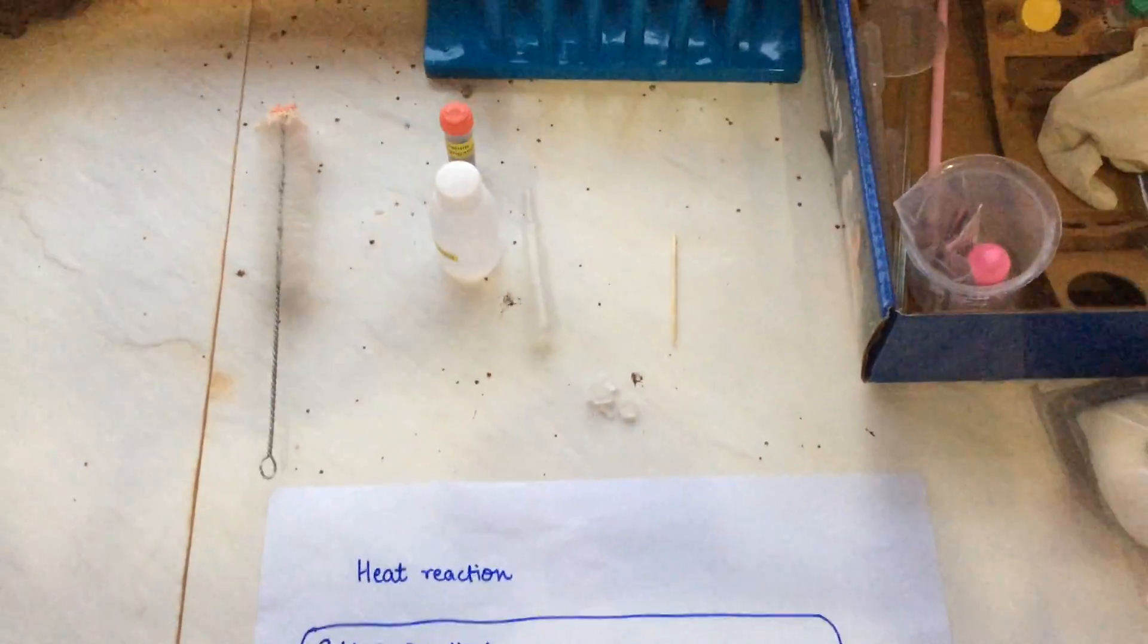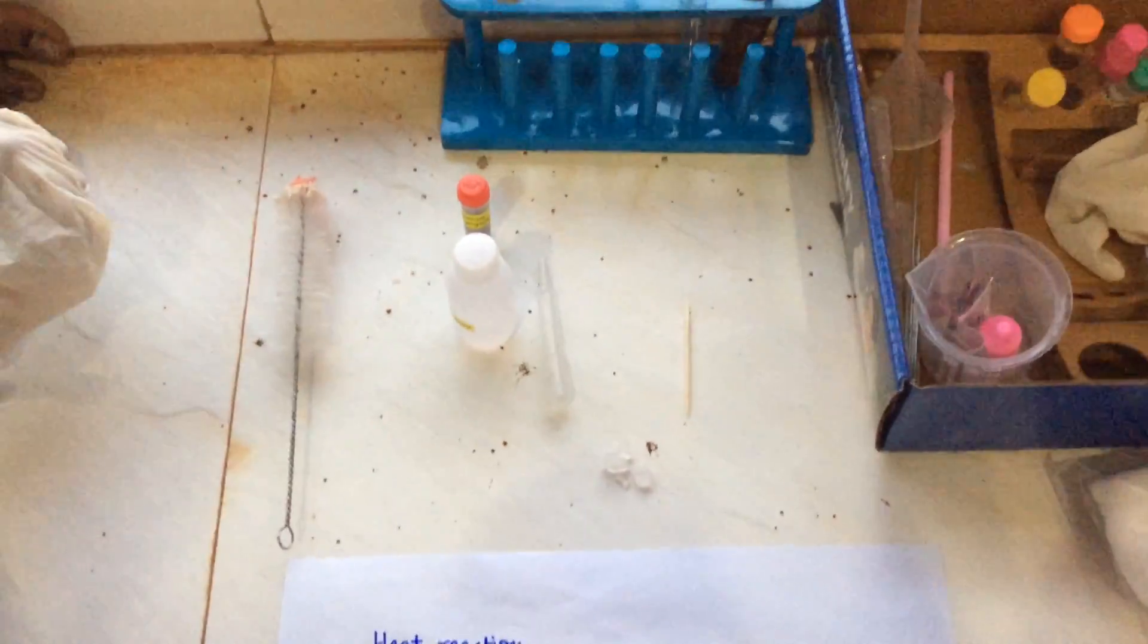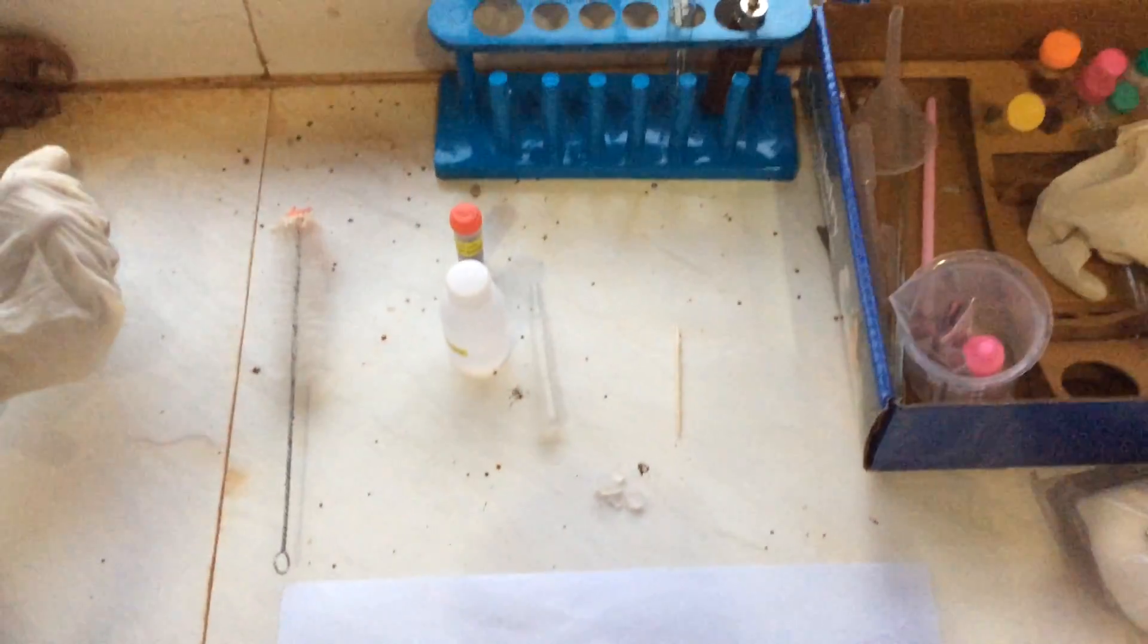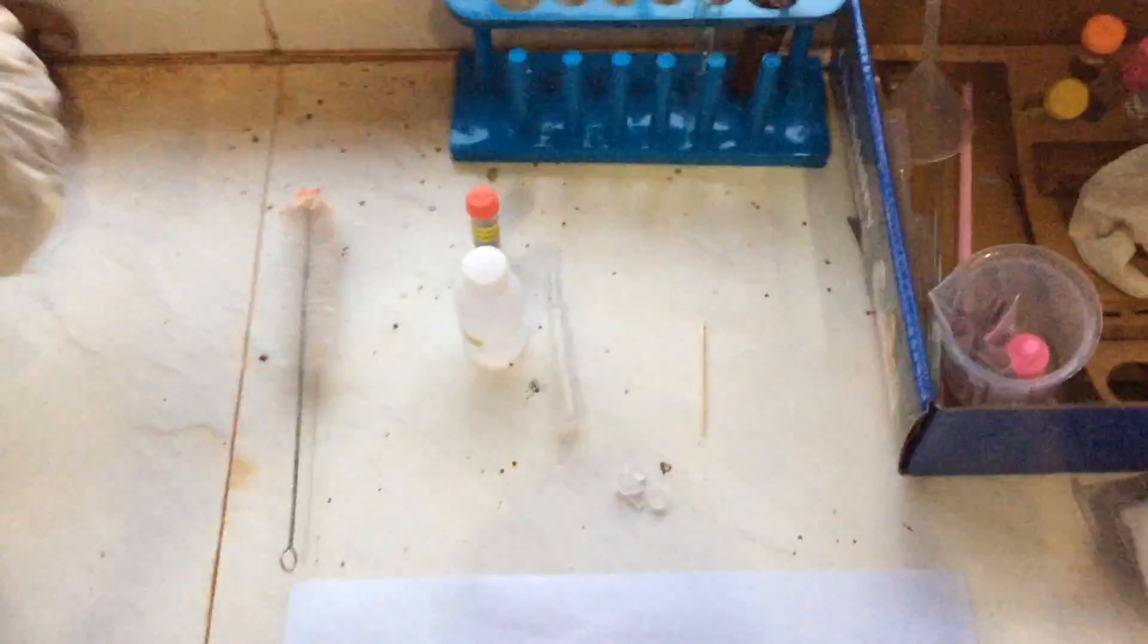Hello friends, today we will carry out another experiment that shows the thermal dissociation of potassium permanganate with the help of the lab solvent ethanol. So the reaction begins like this.